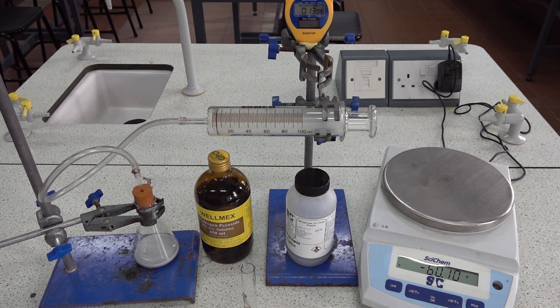Start timing on 5 cm³ of gas. That's 10. You need to make readings of the volume of gas evolved per unit of time from the stopwatch.